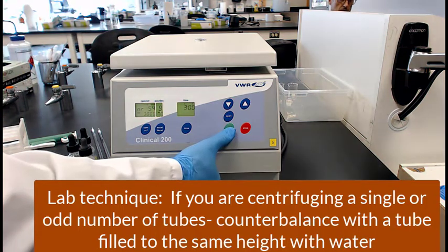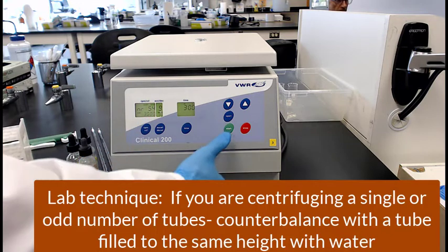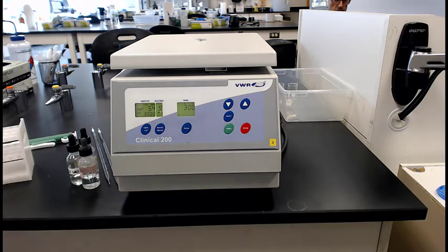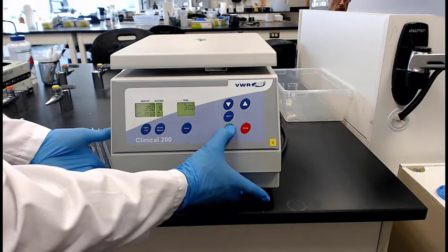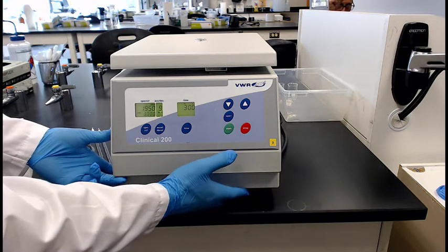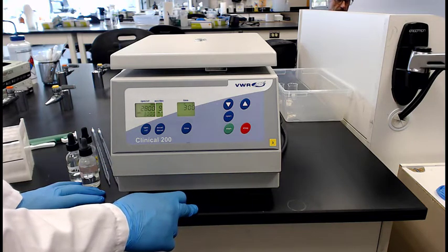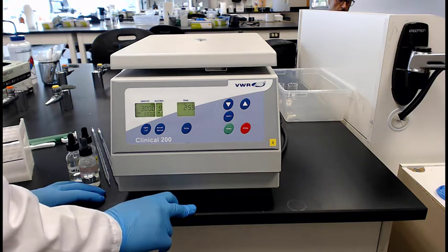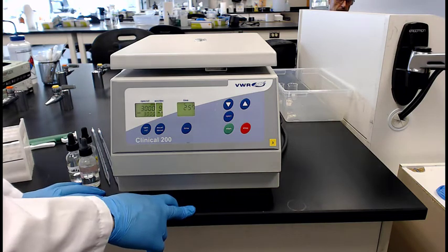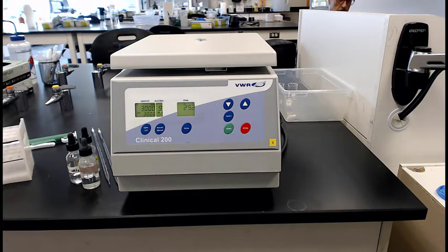All right, and then basically you just set it on, and you've got it set at 3,000 RPMs for 3 minutes. It's hard for you to see, but if you look in that left eye, you can see the numbers crawling up. 2,600. Boom, it's at 3,000. So it went really fast. It gets up to speed really quick. Now it's going to spin here for about 3 minutes.